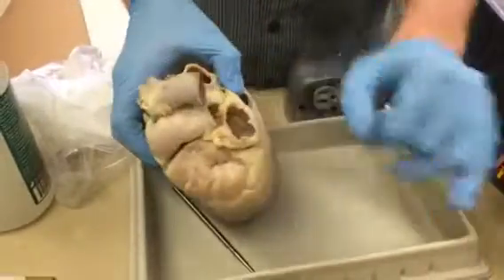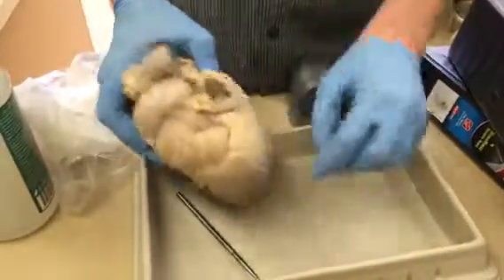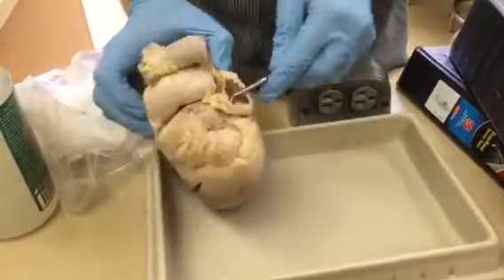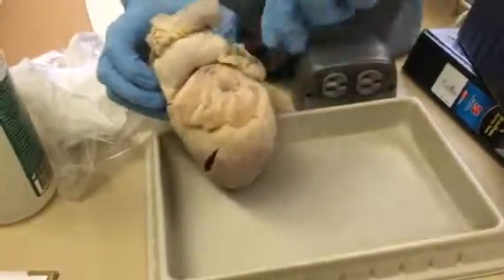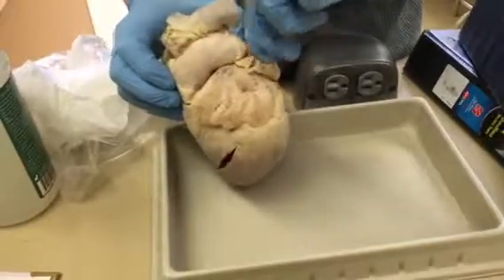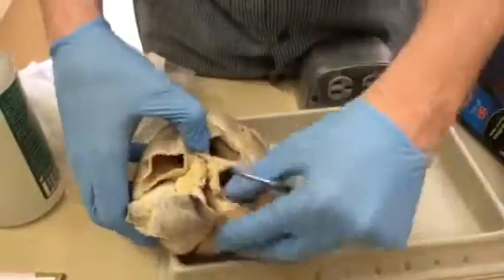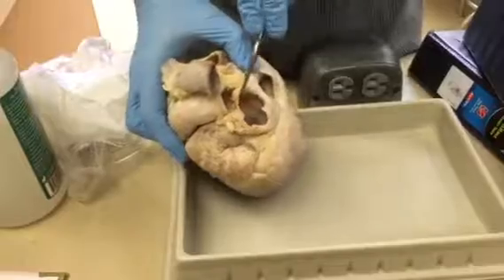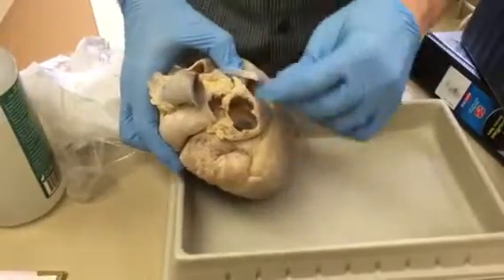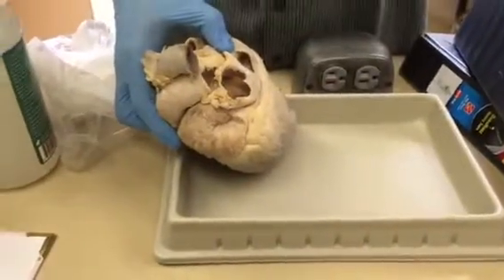All right, then leaving are the pulmonary veins on the left atrium side, and they would be here, but they're all cut off. And you can actually see a hint of, I think, oh, no, hold on. It seems like it should be one, but it's not going all the way through. Nope. I guess they had it cut. So one right there, two, three, and there would have been a fourth one either right there or right there. Okay. So I can't pin those, so you do not need to worry about those. But they do appear on the model. One, two, three, four, the pulmonary veins.